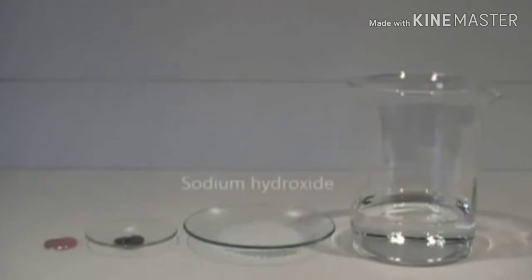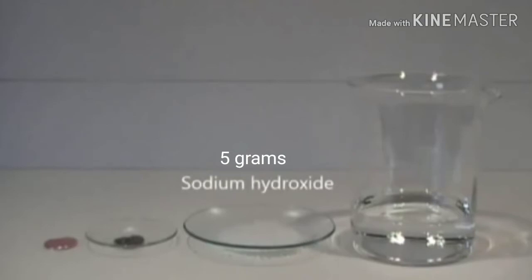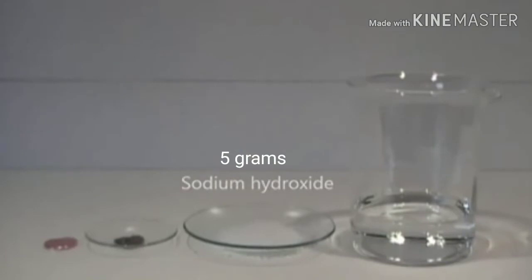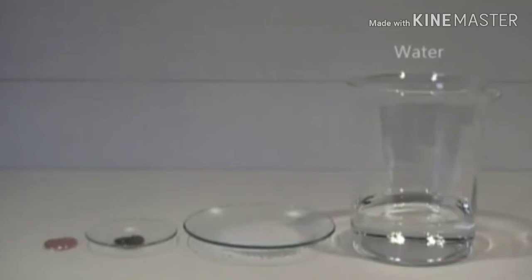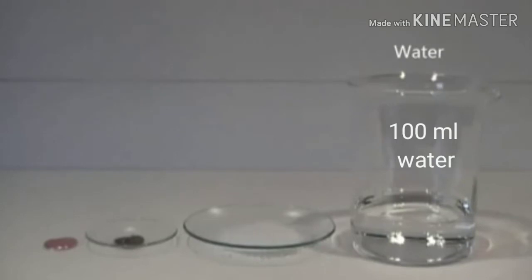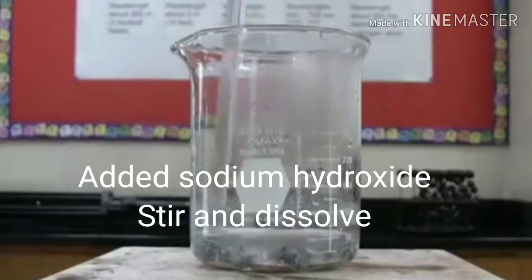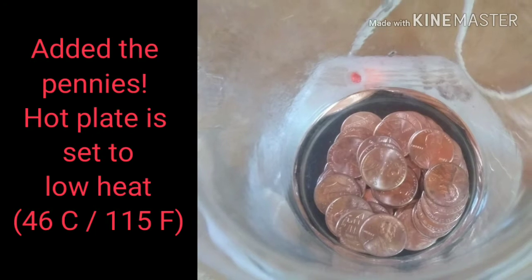The next ingredient is something that does the heavy lifting here: sodium hydroxide. It's a pretty strong chemical, so care must be taken when using it — I needed about five grams. My gloves and goggles are on any time I handle sodium hydroxide. And last but not least, good old H2O, water. I poured 100 milliliters of water into my beaker. The first step was to add the sodium hydroxide into the water and stir it to dissolve it. Next I added my zinc, then moved my beaker to my hot plate and set it to low heat.